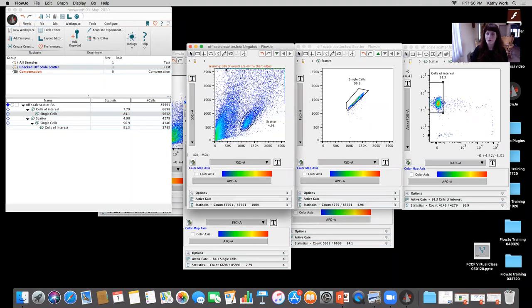We don't want to see very high numbers off scale or anything like that. And we also want to make sure that we're not being so tight on our scatter gating without understanding what that does. Because if you're sorting these cells, that's almost a twofold, right? That's a huge difference. We're going from 3,785 to 5,632. And if you're working with rare cells, and if you're working with a population that you're going to have a hard time trying to pull out, that's not going to do you very well for your downstream applications when you're trying to have a certain number of cells to work with.